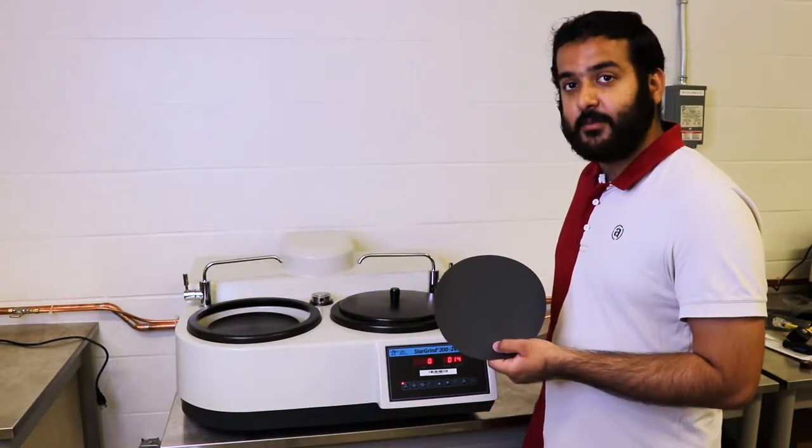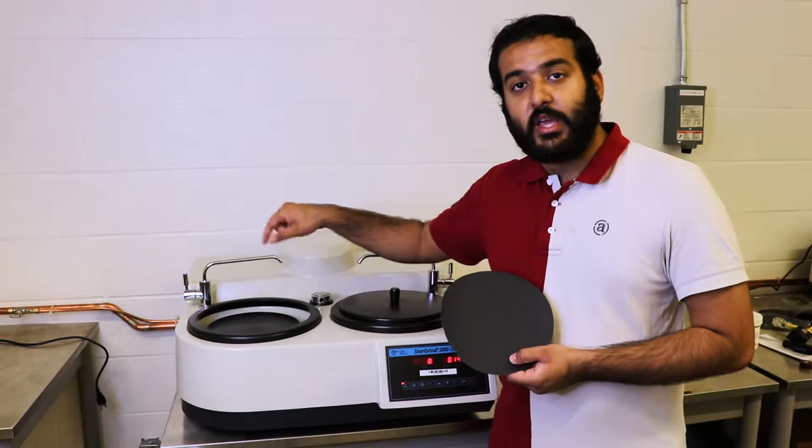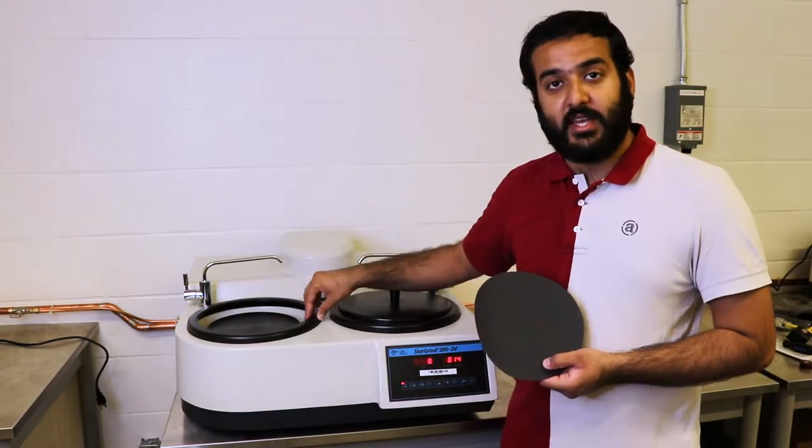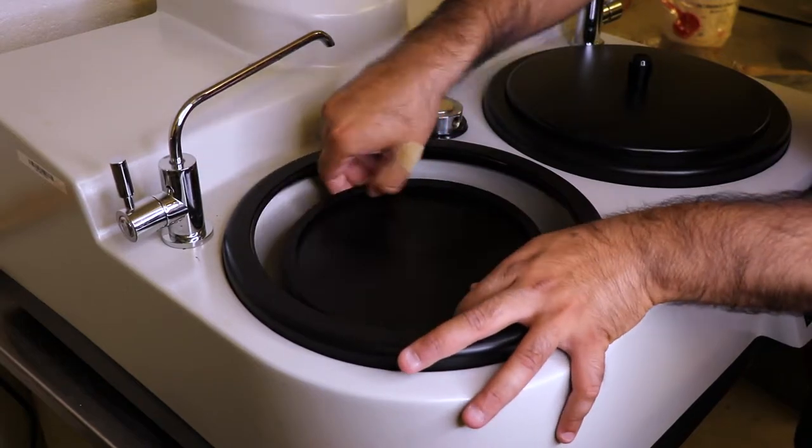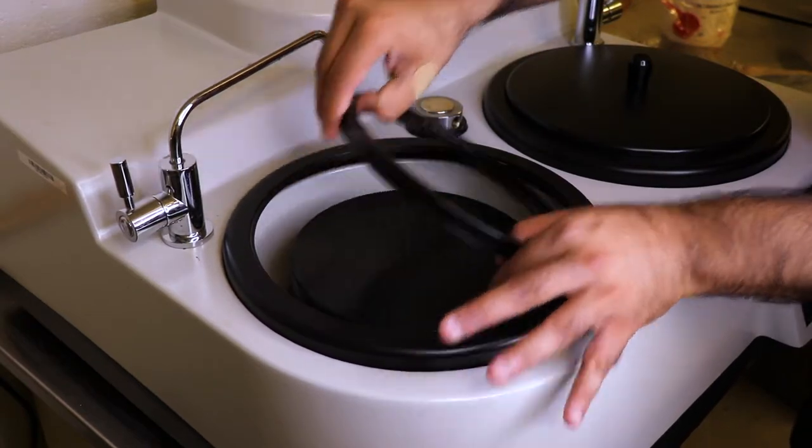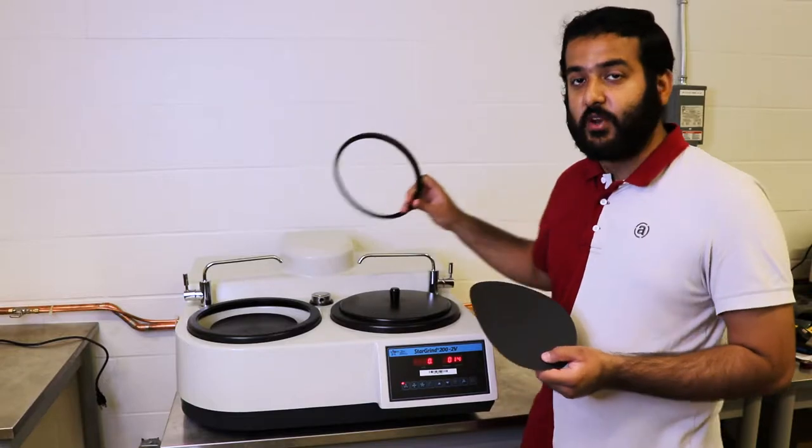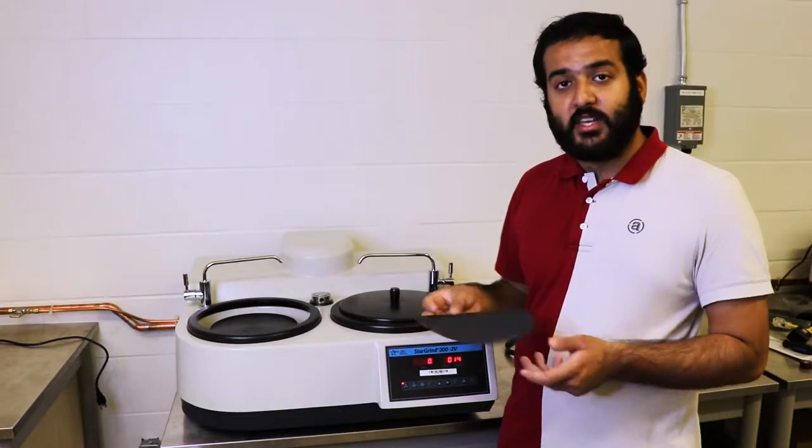Now there's a little ring that's clipped to the side of this rotating plate. You want to remove that ring and put it to the side for now.